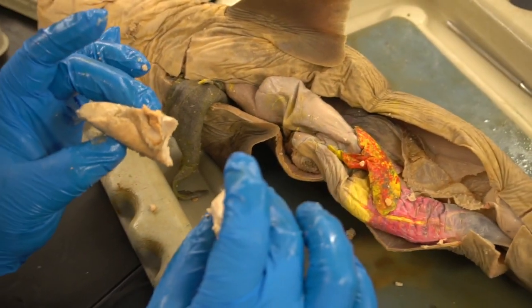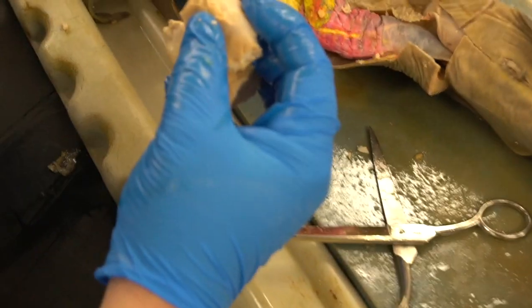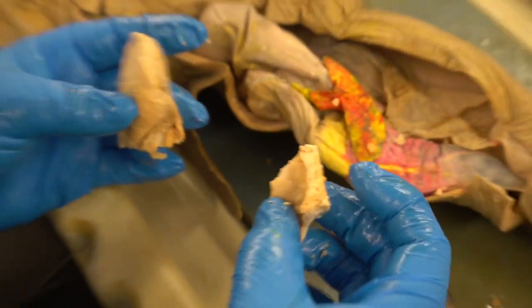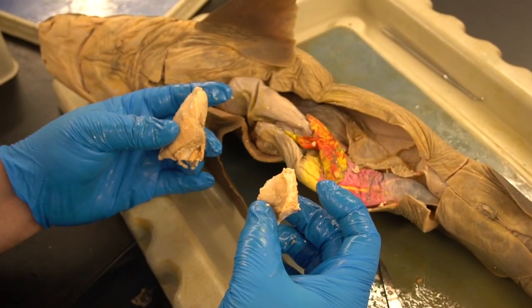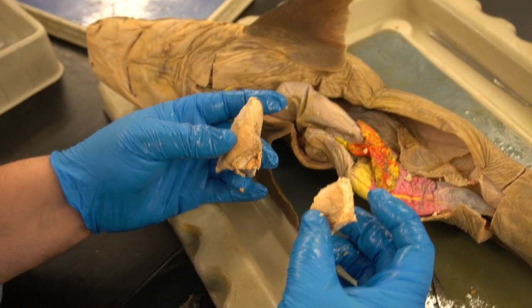Okay, but you could see that this is the egg itself. If you saw them, they are round. Okay, they're just like we think about eggs. They're ovoid. Okay, here this definitely has been through some stage of development. Okay, unfortunately we didn't see a full Monty here, but if I could find one that does, we will certainly be happy to share that.